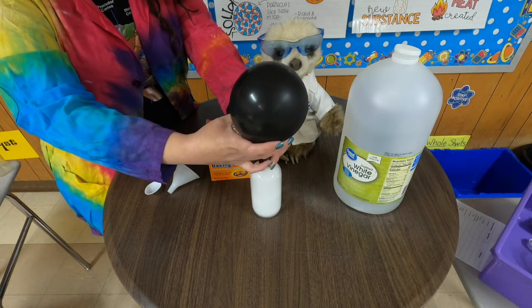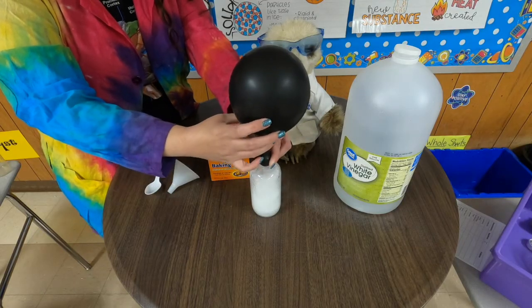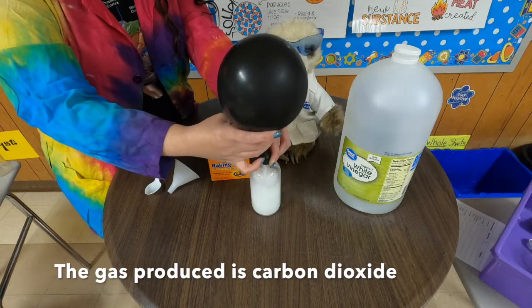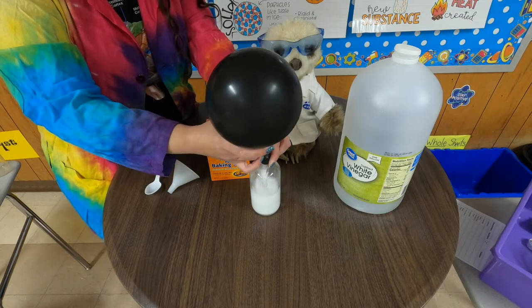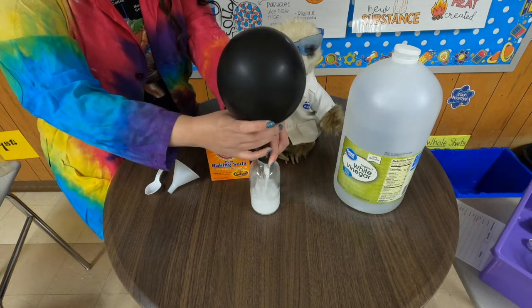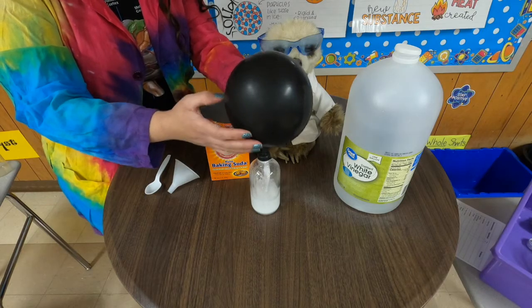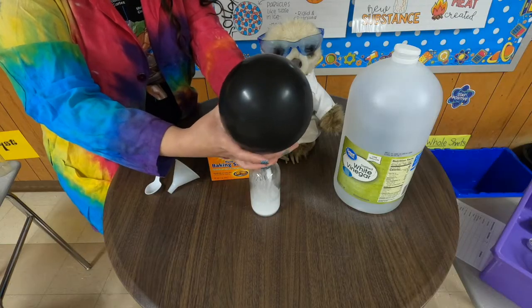So what you can tell from here is that a gas was produced. Okay, here's our balloon full of gas. Now, was this a physical change or a chemical change? So this was a chemical change. What is our evidence that this is a chemical change? What you should have answered is a gas is produced.